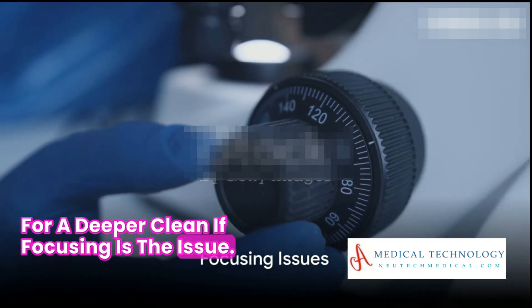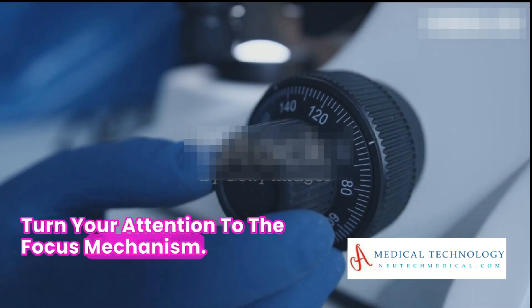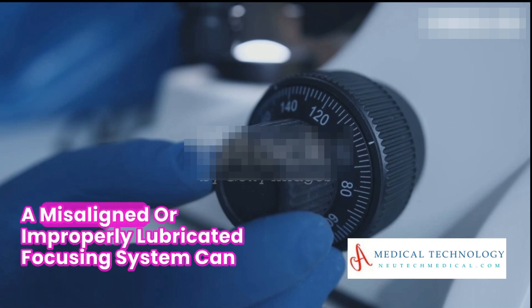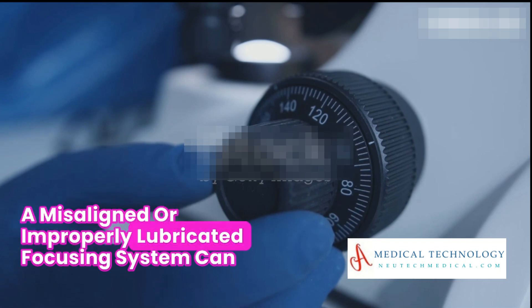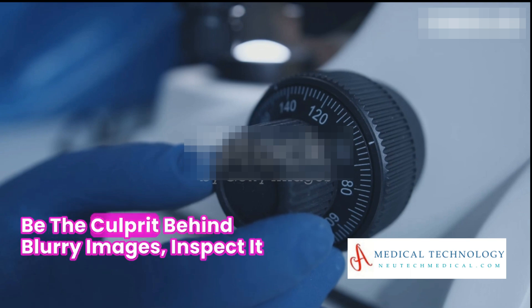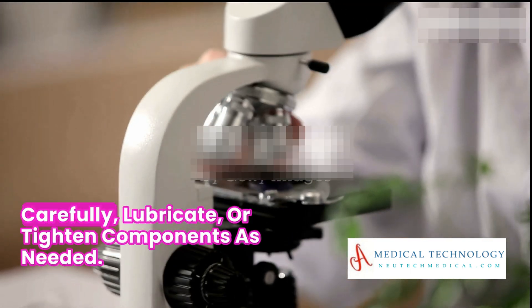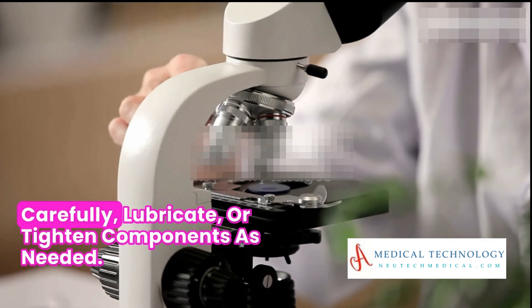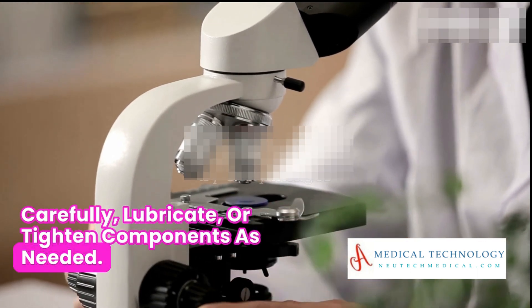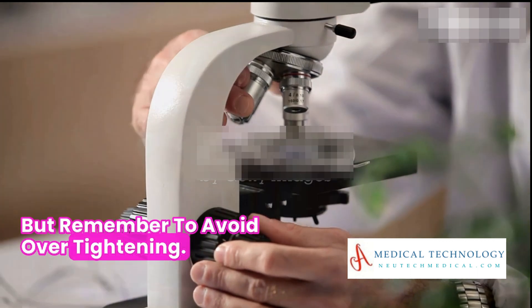If focusing is the issue, turn your attention to the focus mechanism. A misaligned or improperly lubricated focusing system can be the culprit behind blurry images. Inspect it carefully, lubricate or tighten components as needed, but remember to avoid over-tightening.